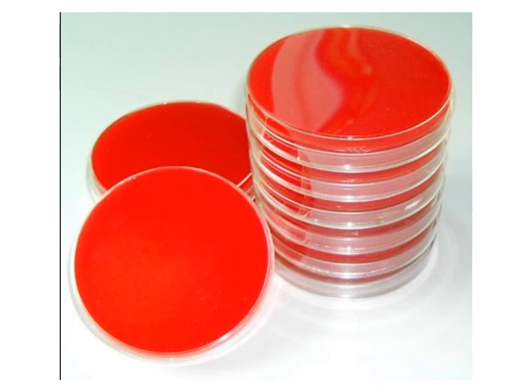While this is a different type of agar than the previous, the point of this picture is to show you that once I have streaked my plate, I want to place my dish in such a way so that the lid is on bottom and the agar part is on top. This keeps any kind of collection of precipitant from building up on the agar plate, which would cause an inhibition of the bacteria from growing.